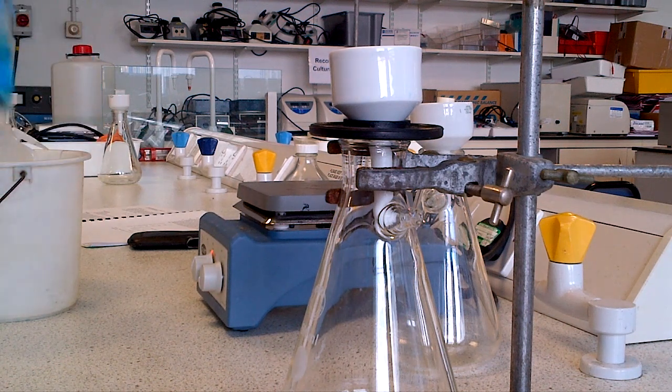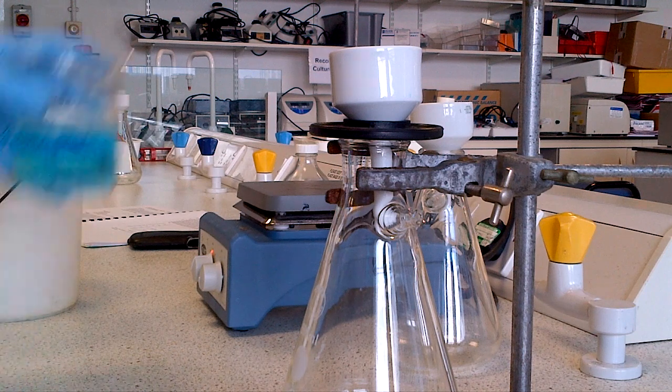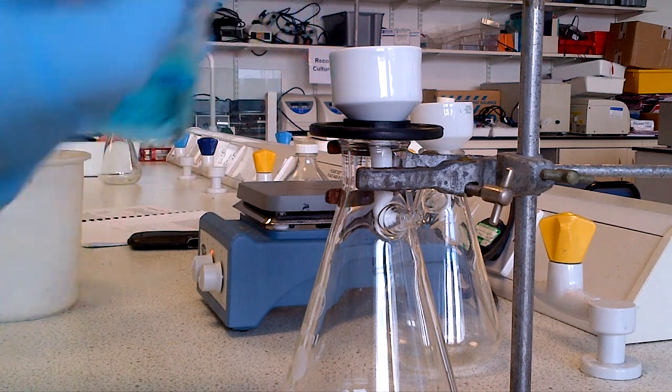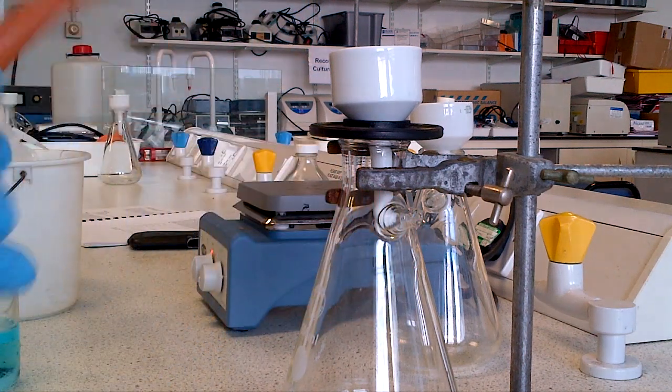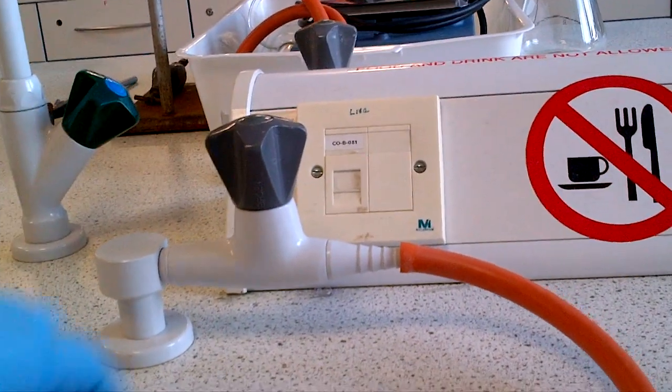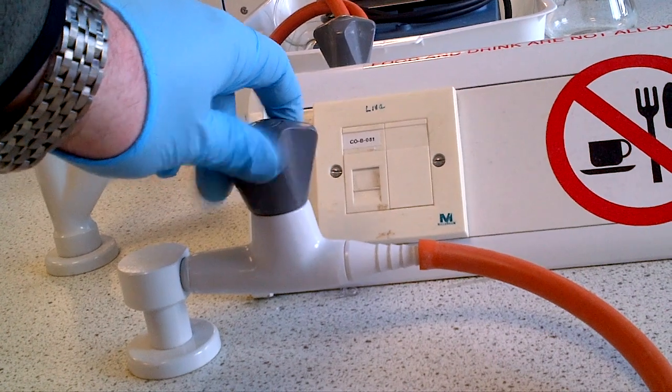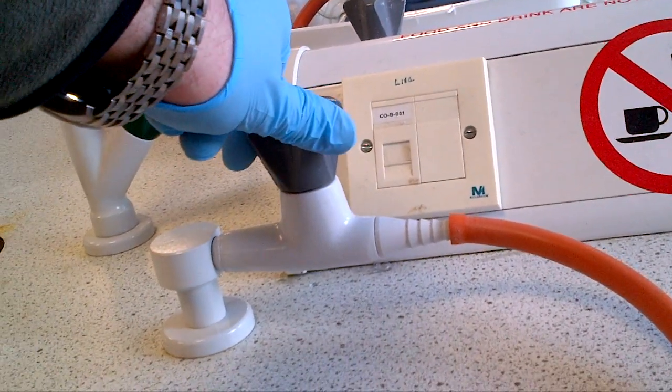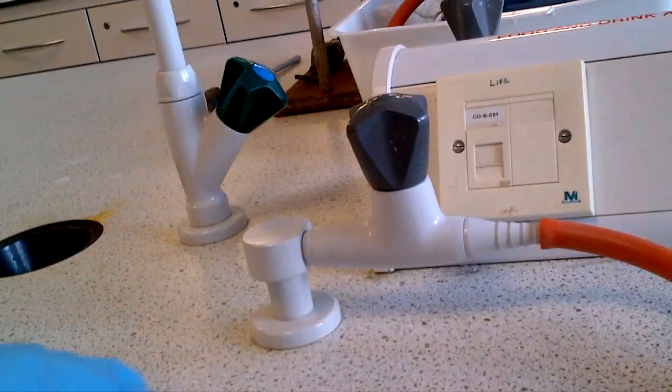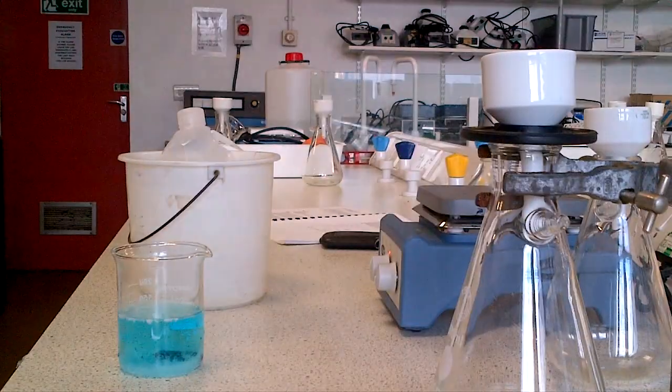What you need to do is filter via here, and you'll need a source of vacuum. In each lab there are some taps which is the vacuum line. I'll just turn this on, you can hear a whistling noise.